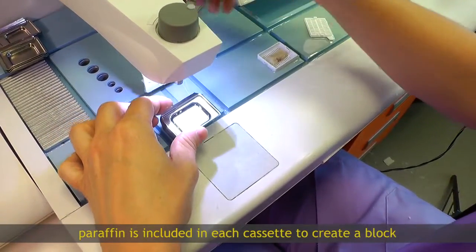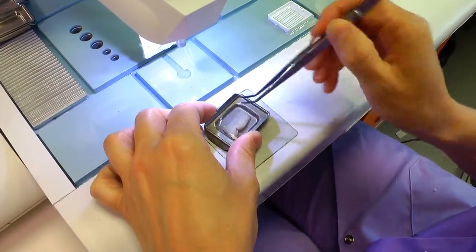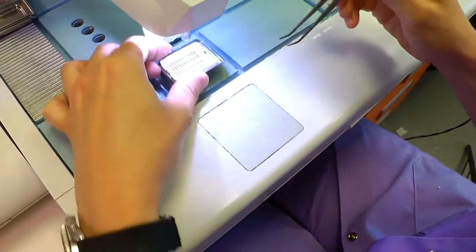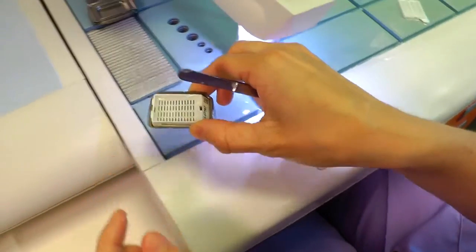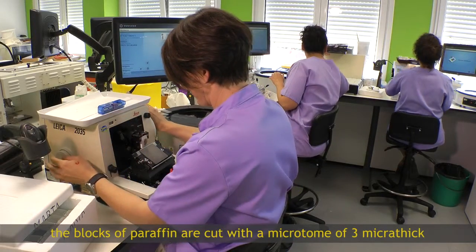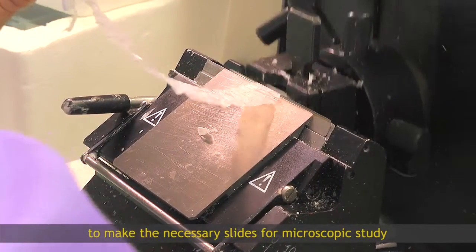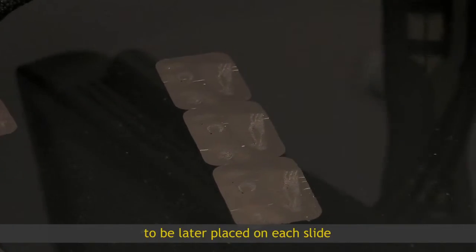Paraffin is included in each cassette to create a block. Any extra paraffin is eliminated once it has solidified. The blocks of paraffin are cut with a microtome at 3 microns thick to make the necessary slides for microscopic study. The slices are placed in a tray of water to be later placed on each slide.